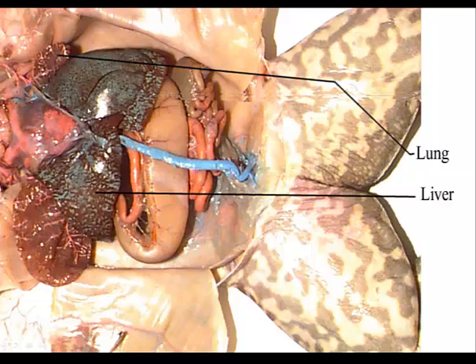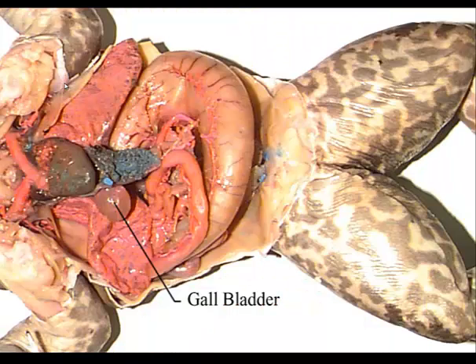There's no central lobe here. The left anterior lobe is on the left side towards the front, and the left posterior lobe is on the left side towards the back. Do not remove the liver, but look underneath the right lobe to find the gallbladder.